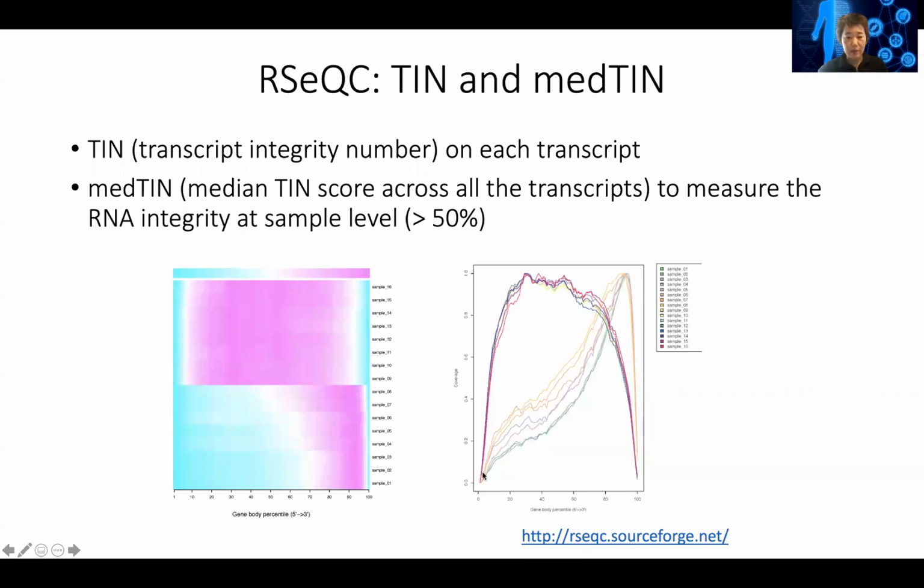If you have a high quality sample, you can see these samples are pretty good. Their overall transcript coverage is calculated across an average gene from the beginning to the end. You can see most of the time the reads really cover the whole gene. But if the RNA sample is degraded, remember that happens from the 5' end, you can see most of the reads landed on the 3' end. And so if the median TIN score is less than 50%, you might still be able to read out the transcript from the 3' end, but it could be that some transcripts are already degraded, completely gone. You just don't know. And you have to be very careful in interpreting those results.